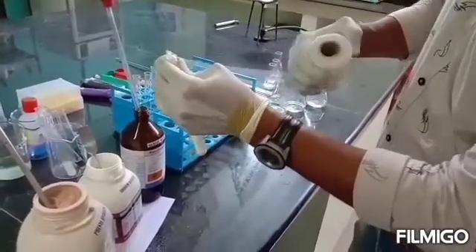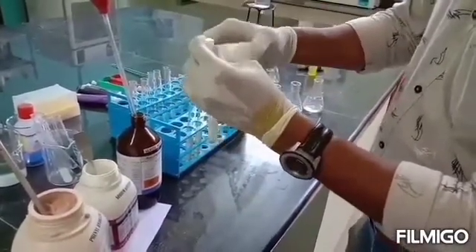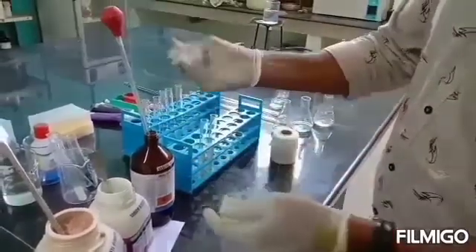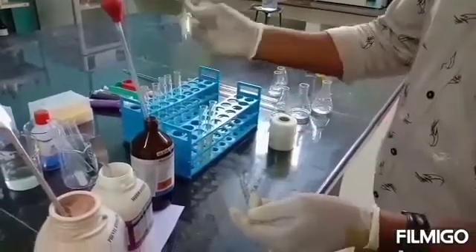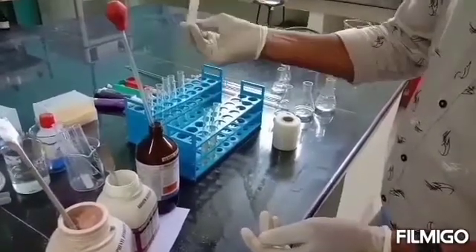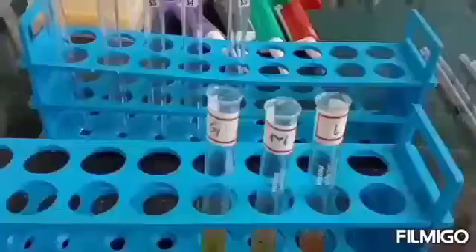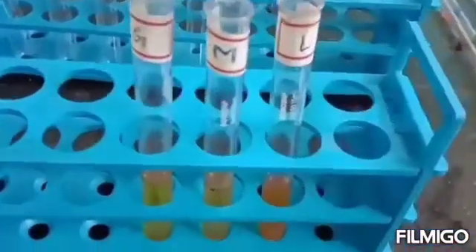It is shaken well, and all three test tubes in which glucose, maltose, and lactose are taken are properly labeled, because we have to keep them in boiling water bath for half an hour.